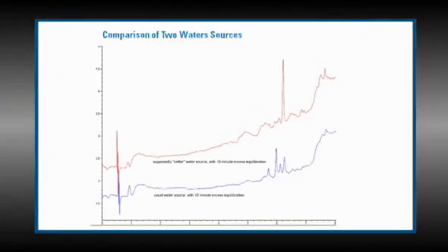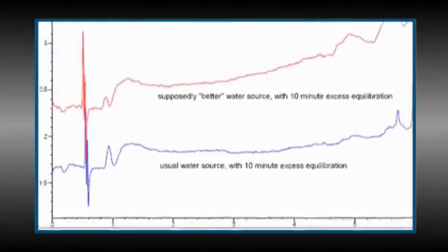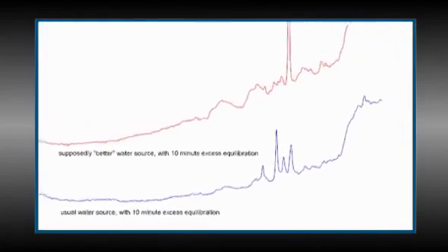In your in-house purification system, it may be necessary to change the activated charcoal filters more often. Some users prefer purifying water by using an old reverse phase prep column, and this will remove hydrophobic contaminants from water that has passed through it. You can change water sources and see if the ghost peaks are eliminated or changed. This chromatogram shows a difference in baseline from different sources of water.